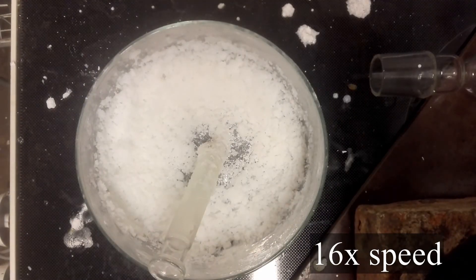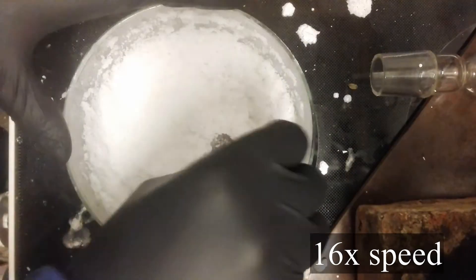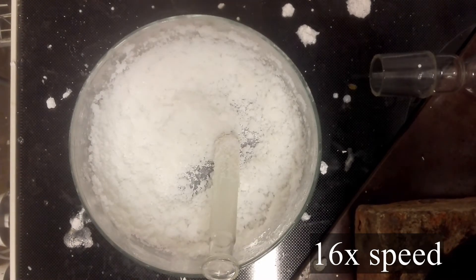You can maybe see the steam coming off. Just crush it and when it's dry pass it through a sieve so you only have the fine particles.